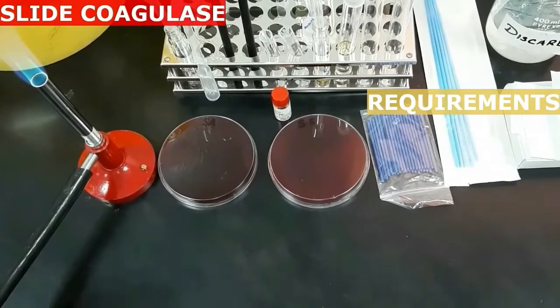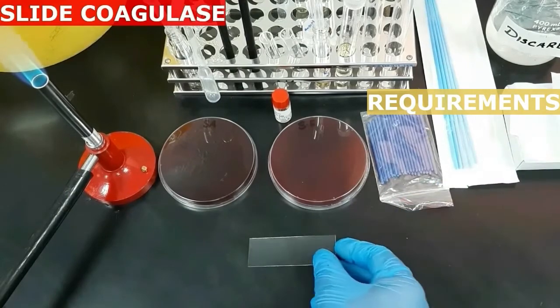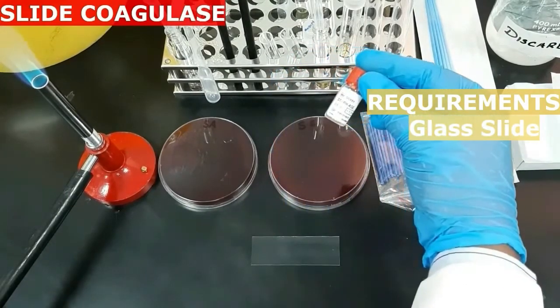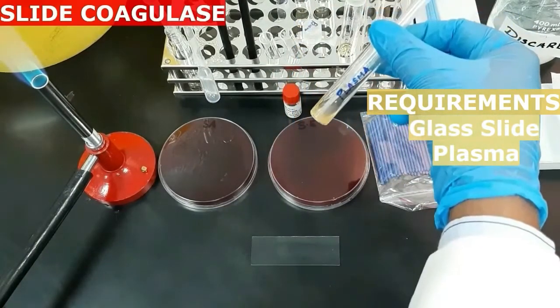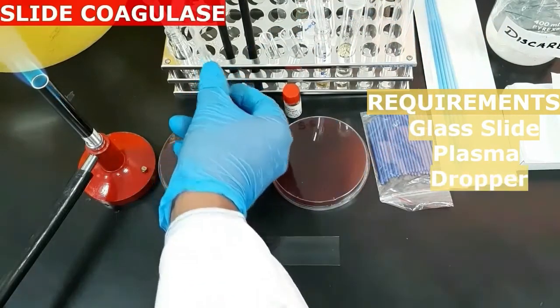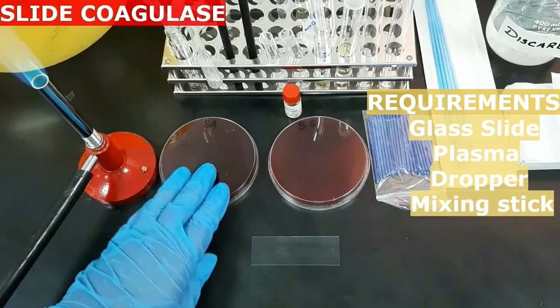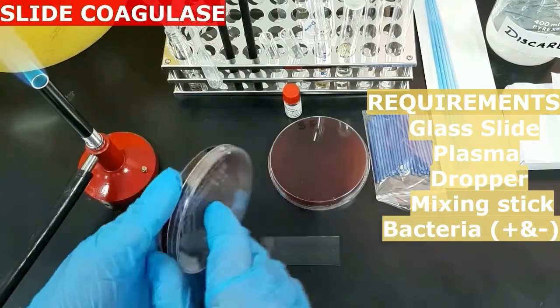First, see the requirements needed for the slide coagulase: a glass slide, undiluted plasma, a dropper, a mixing stick, and positive and negative control bacteria, or you can use a test and the control bacteria.